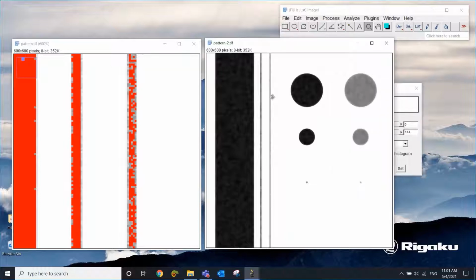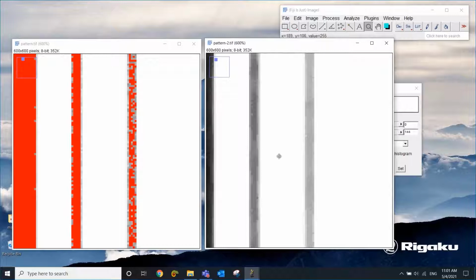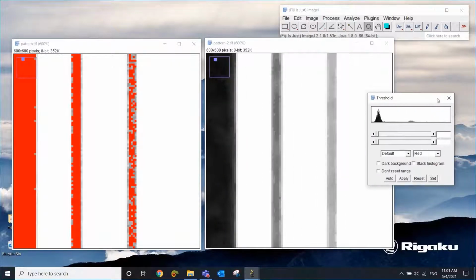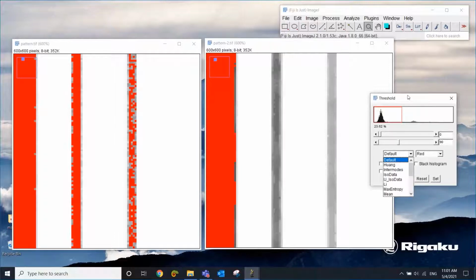But once you do smoothing or noise reduction, zoom into this similar area, and let's say apply the same threshold. So in this case, by just adjusting the threshold, you can more or less, that's too much, okay. You can stay away from this gray line but select at least most of the black areas. So you can see that the smoothing can make your segmentation easier or cleaner.